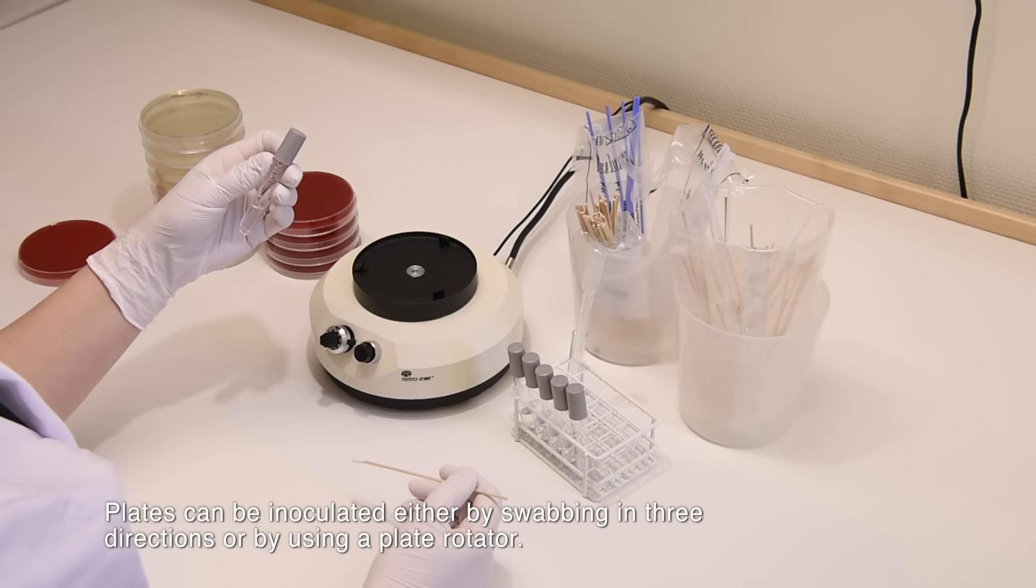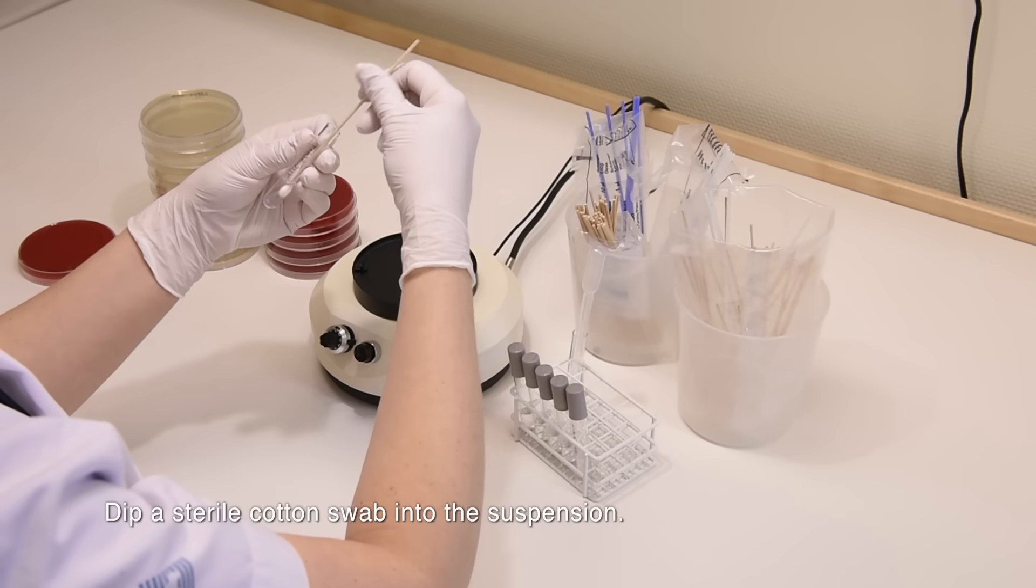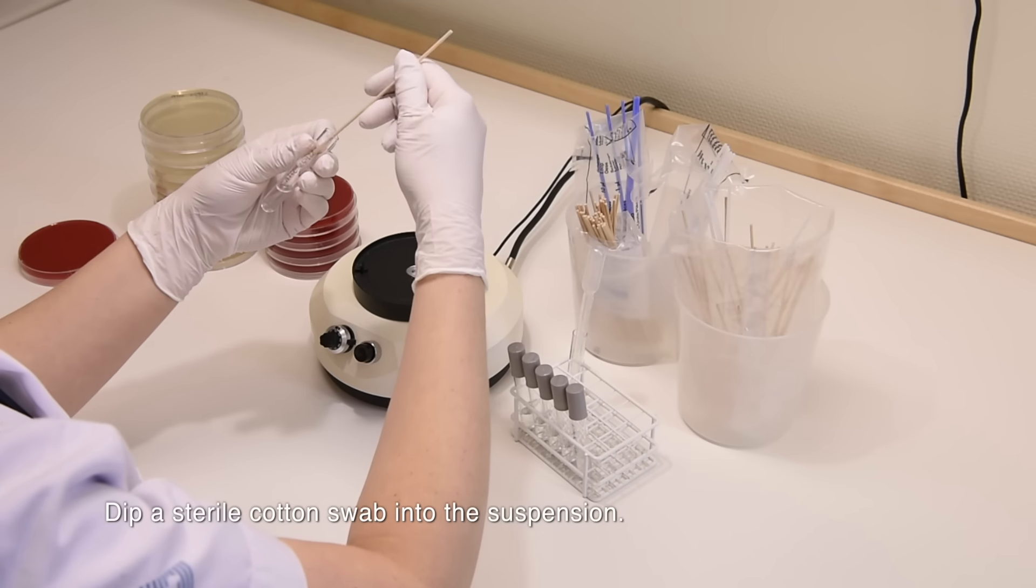Plates can be inoculated either by swabbing in three directions or by using a plate rotator. Dip a sterile cotton swab into the suspension.